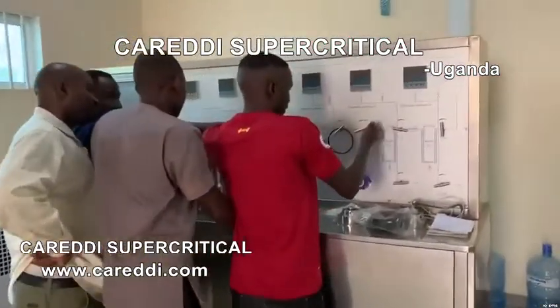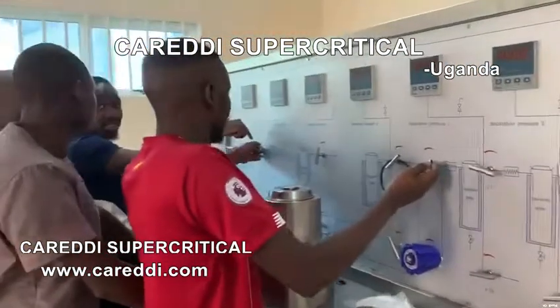You have the pressure to further decrease. Yes, further decrease. That's like the outlet — the inlet. Yes.